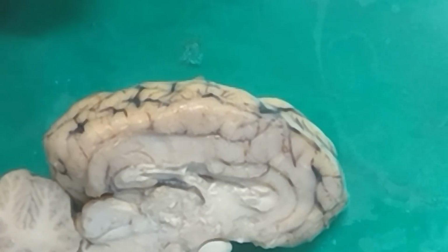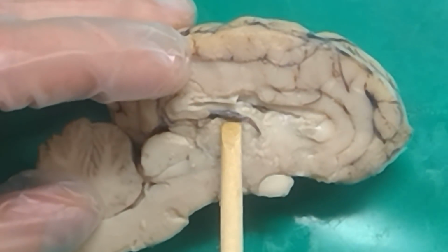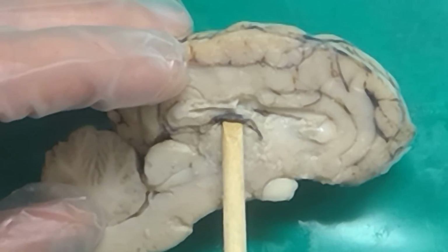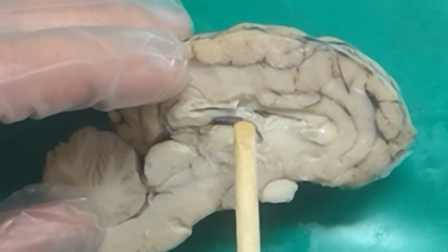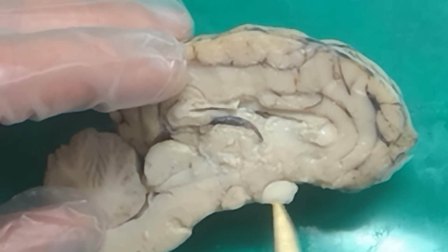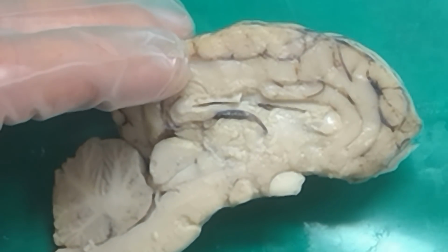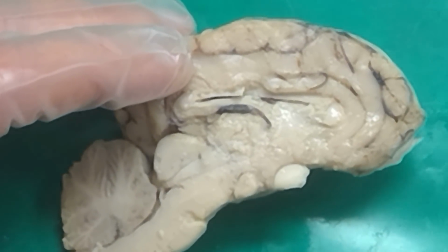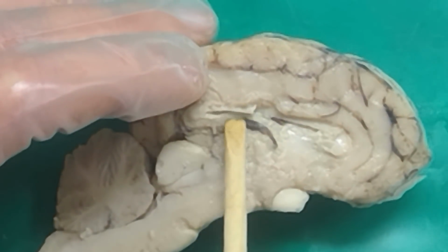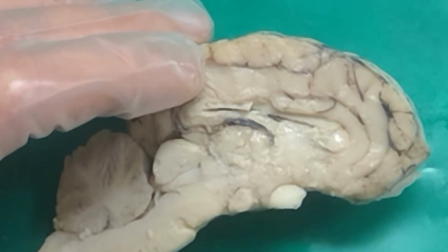Yes. Is that like the black part just above the thalamus? Yeah. Good question right there. Yes, this black stuff right here, this is choroid plexus. So if you have a question asking you, what is this dark substance sitting inside the ventricle or something like that, that's when you'd want to answer choroid plexus. And that converts the blood into cerebrospinal fluid. Correct. Fornix is this guy right here. It's the white fibers that are going along right there. Yes.